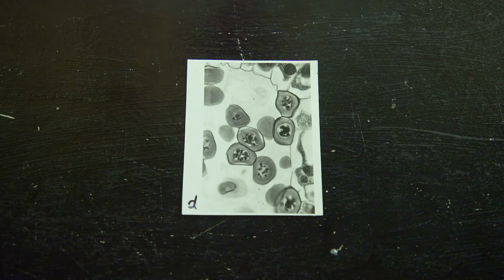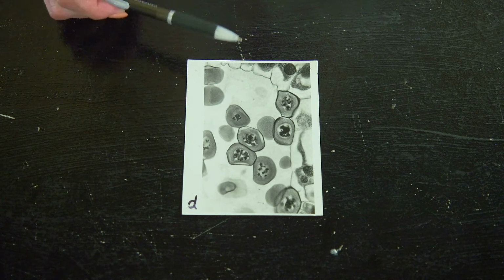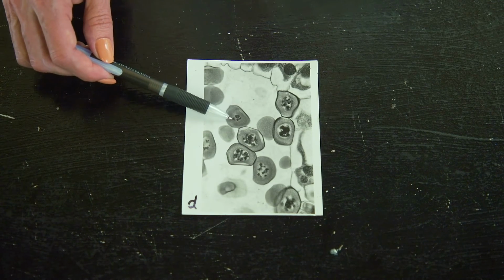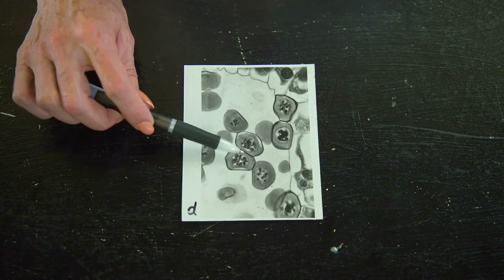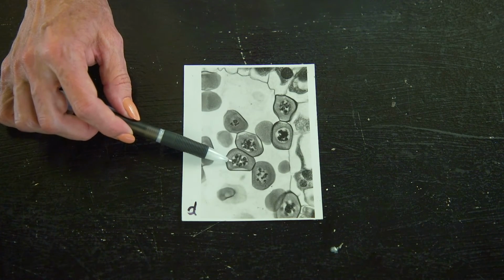And here we go on to our third stage of prophase 1, which is called pachytene, where crossing over is taking place. And you can see in some cases the chromosomes are really close together for the crossover to occur. Here we see the fourth stage of prophase 1, which is diplotene stage. Crossing over occurred during pachytene. Now we see visible evidence that crossing over has occurred, and it is a chiasma, or chiasmata in plural. The chromosomes are also starting to pull apart.